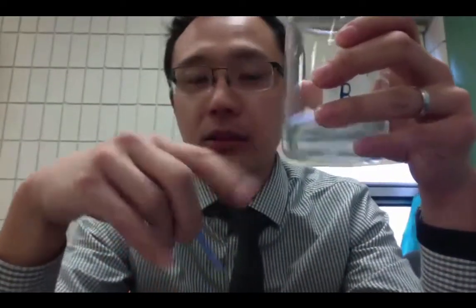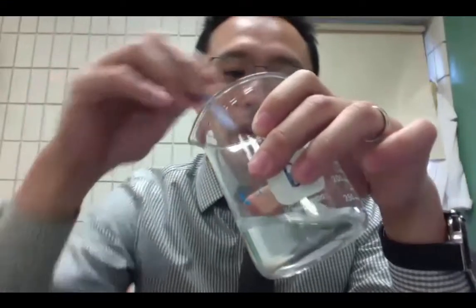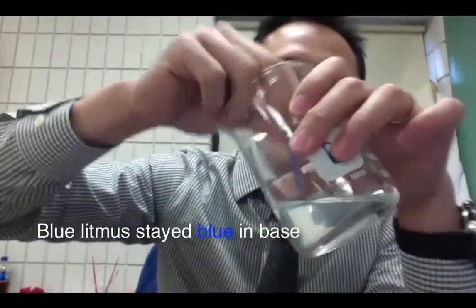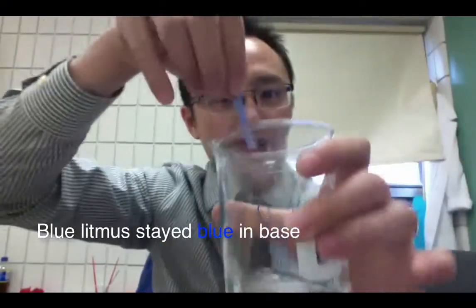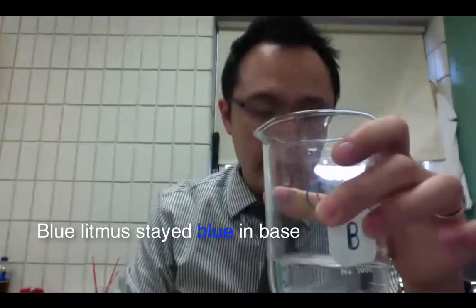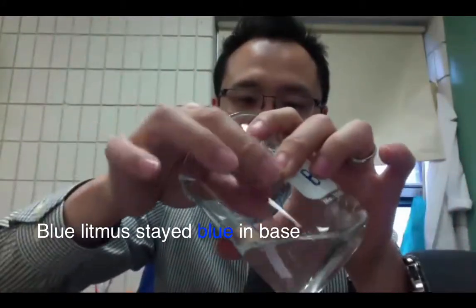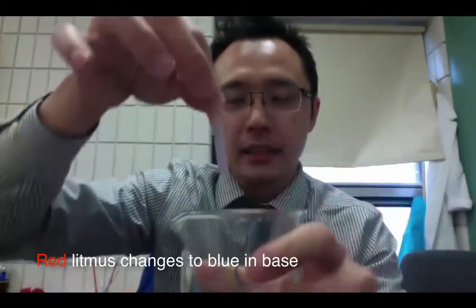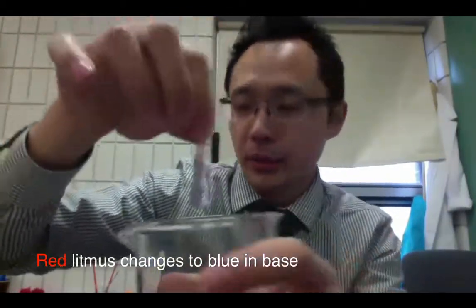So I'm going to put the blue one first. So this is base because it has sodium baking soda and we're going to put this blue one in and it doesn't change color. But let's see if it changes color with the red one. You can see that it does change color. So the red one changes into blue.